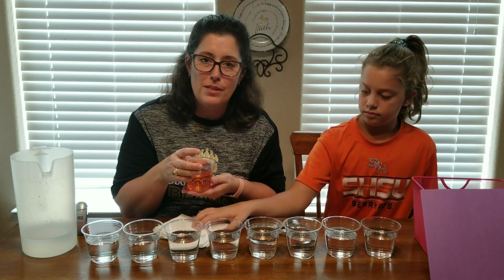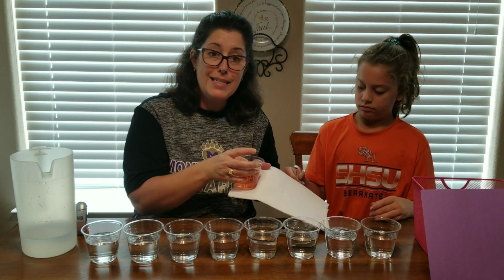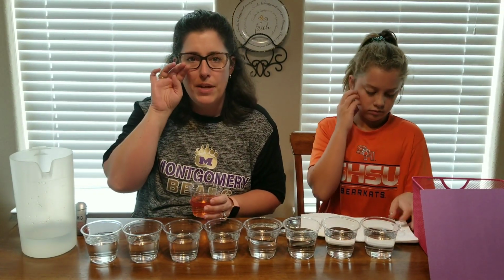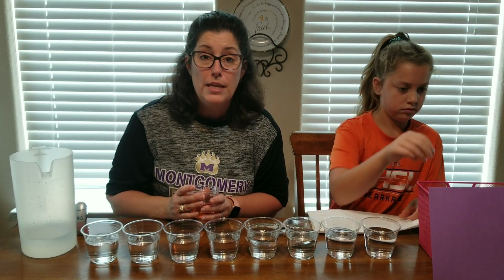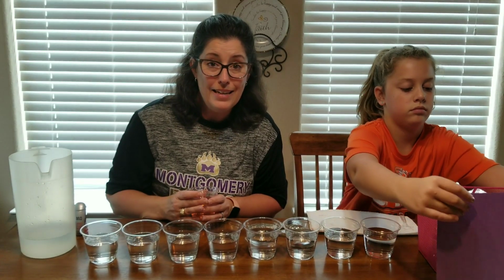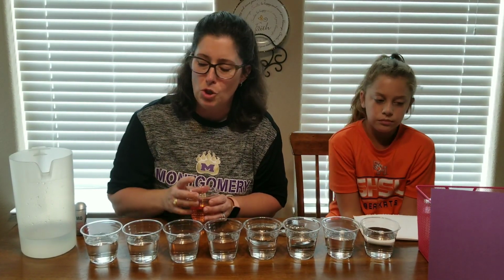We're going to test several substances, and because some of them may actually take a little bit of time to dissolve, I'm going to take pictures throughout the day. It's about noon now, so I'm going to take pictures every 1 to 2 hours of our results and see if we see any changes over time, and I'll post those with this lab video. So if you don't see evidence of it dissolving right at the beginning, then you're still going to have a chance to check back later and see, did it in fact dissolve and was your hypothesis correct?